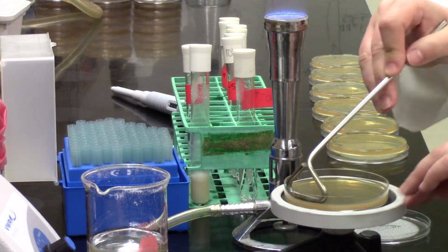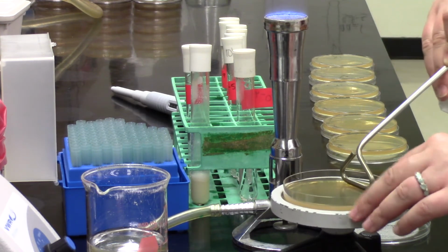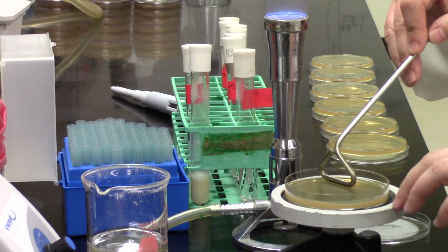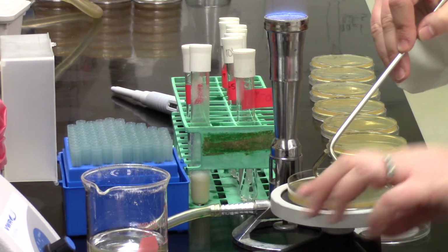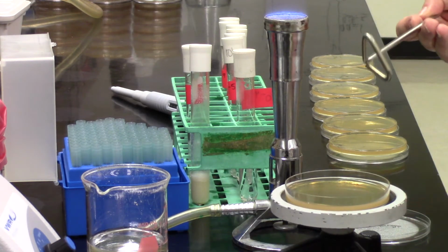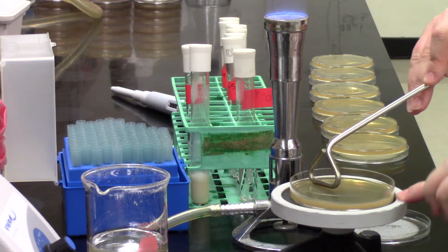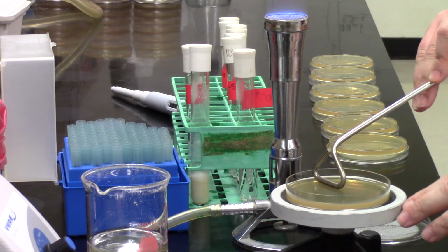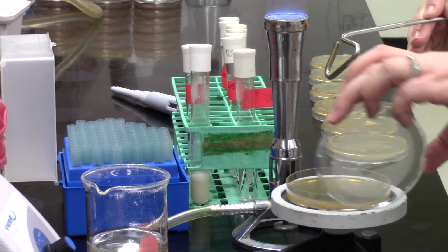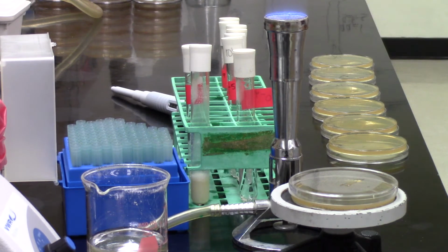One of the things obviously is that you want bacteria spread everywhere on the plate so there aren't clumps of bacteria anywhere. And also you want that 100 microliters to fully absorb into the plate. What she's doing now, which is always what you typically do right at the end, is hold it kind of up against the edge of the plate, as you can see there, and just do the outside rim of the plate. So you're just going to turn, and it's going to go all the way around the rim instead of back and forth. And then once you're done, you want to cover that plate up in a timely manner. You don't want it sitting open to the air.